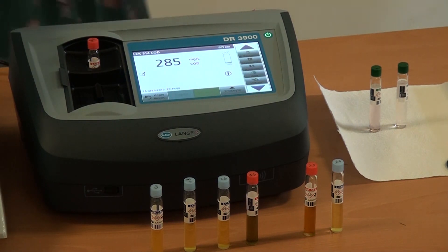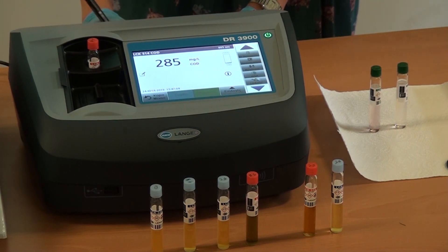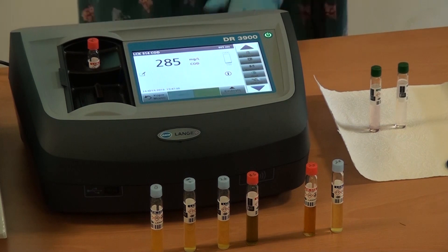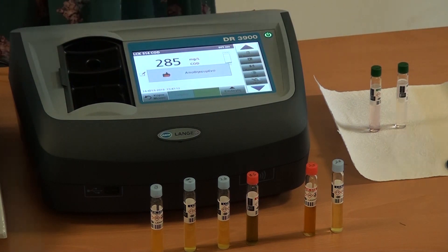Where's the pipe? 285. Okay, but it's a real sample — yes, unknown. Exactly.